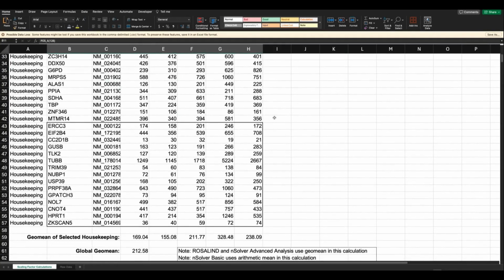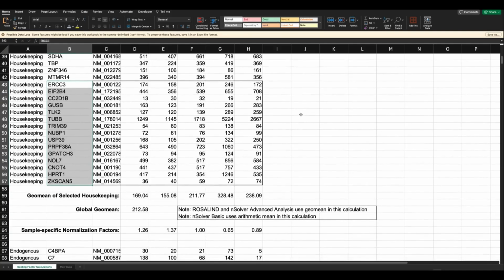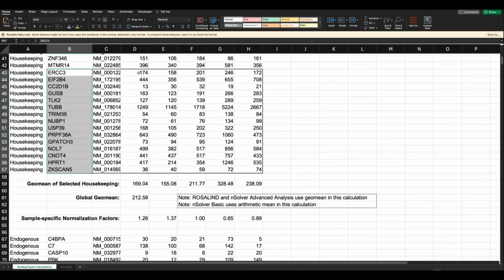So in this data set, we have 5 samples. We have this large potential set of housekeeping genes for normalization. We have selected that we want to use this set of housekeepers for normalization. So let's assess the relative abundance of these housekeepers in all the samples. In each sample, for example sample 1, with our housekeepers selected for normalization, what is the average? In this case, we use the geometric mean. So we calculate this geometric mean. Here is the geometric mean of all of these genes in sample 1, sample 2, sample 3, sample 4, sample 5.